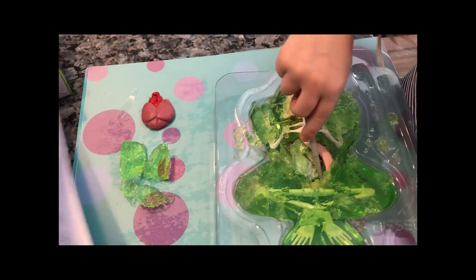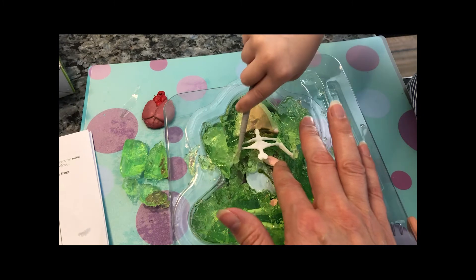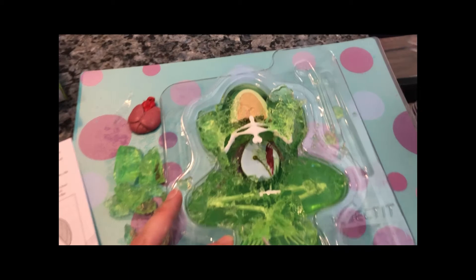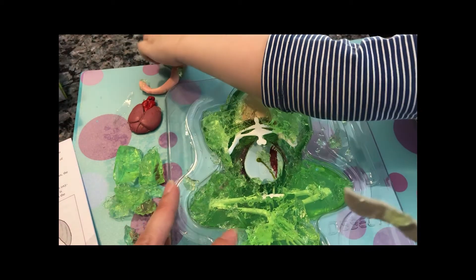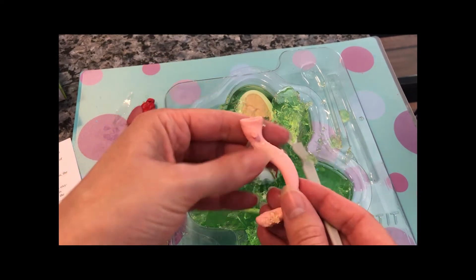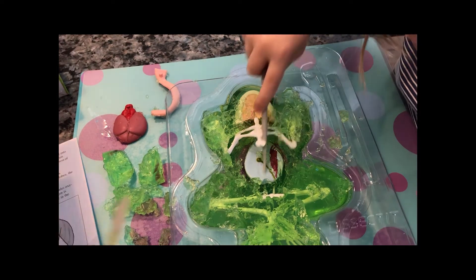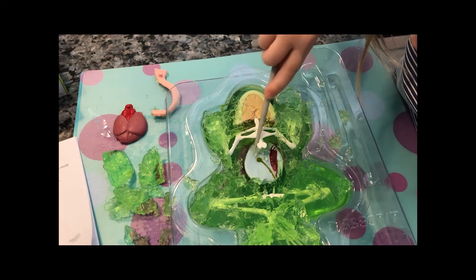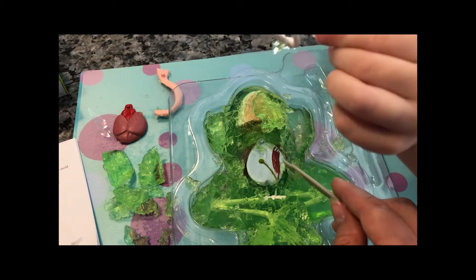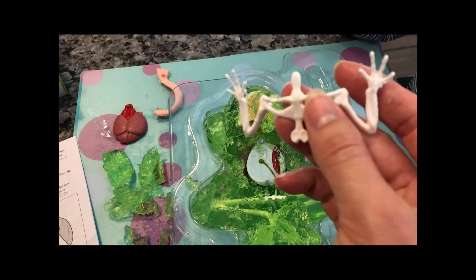Let's see what that is. What is it? This guy is his stomach. See? I got the stomach. You want to show it to everyone? Here, we got the stomach. Now what's the next thing to find? What else do we have in here? I got the arms out. Yeah, these are the bones. I got the bones out.